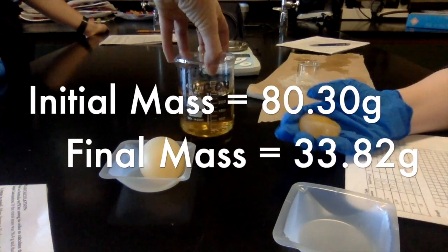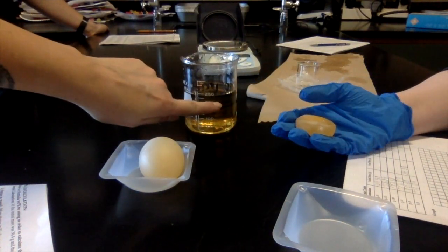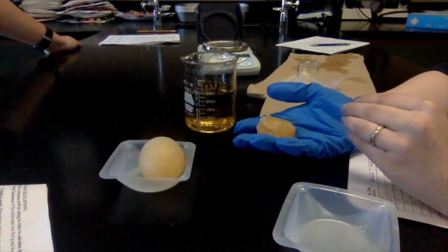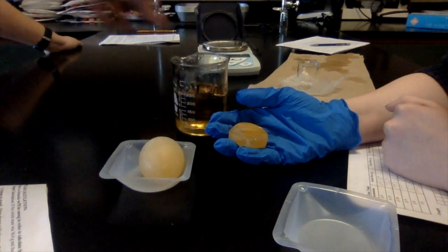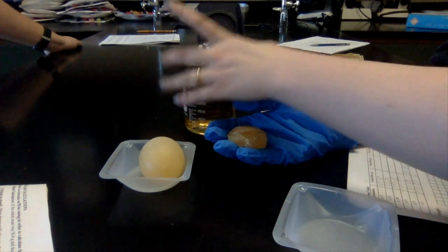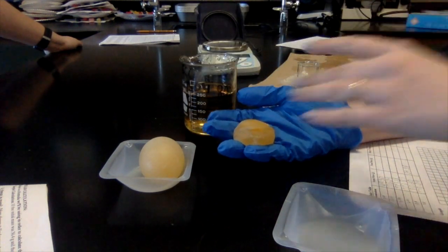Now tell me about the liquid, because this was the 80% starting height of the fluid. And look how much it increased. From here to here. So what went in here? And look at the viscosity. What do we think? It's not as thick as it was before. So does it have more water or more fructose? More water. So it took water from the egg.